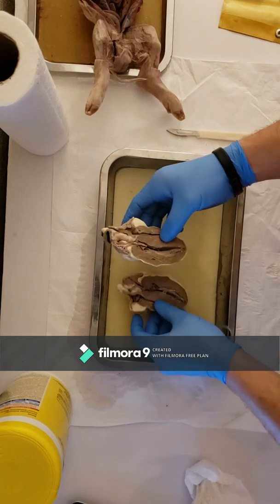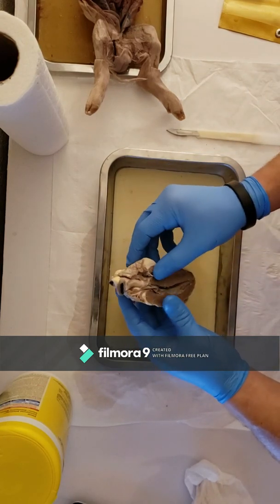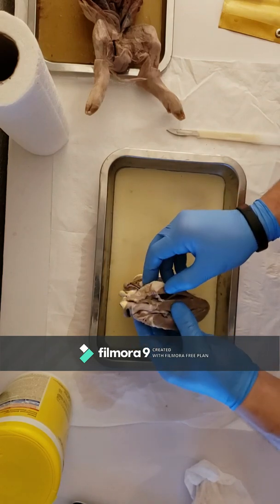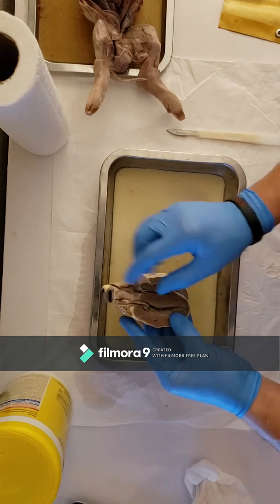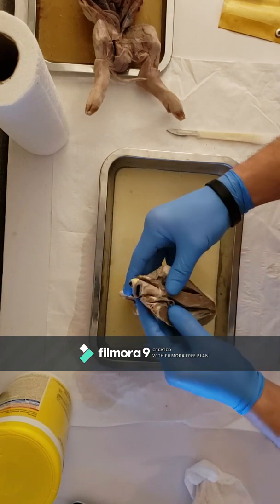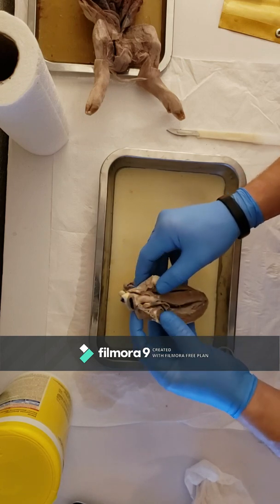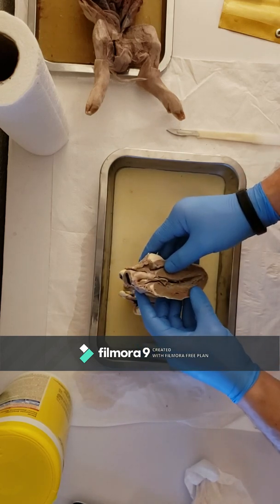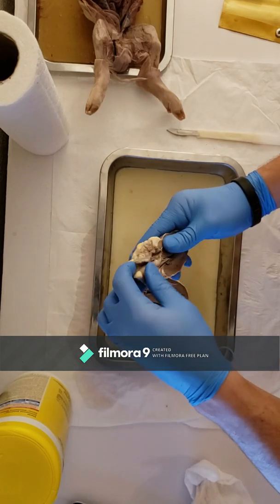The ventricles. So this is the right ventricle. This is the left ventricle. These are the auricles. The atriums are anything between these ventricles, after these valves. This is the tricuspid, this is the bicuspid. These are the atriums in the auricles. The pulmonary trunk is right here, all these giant veins and arteries.